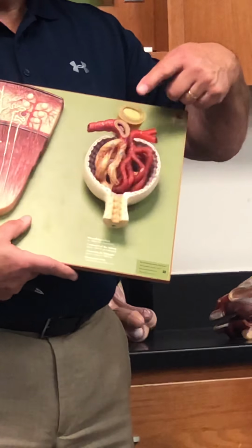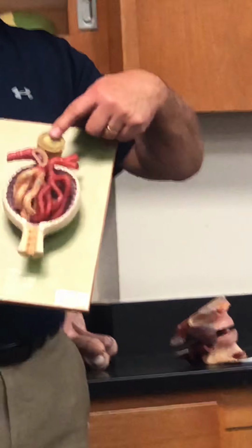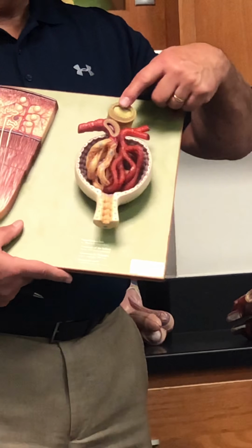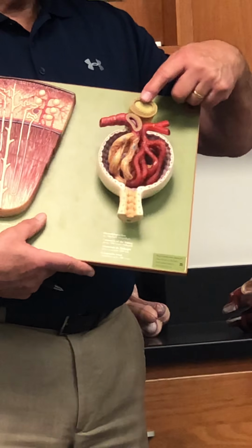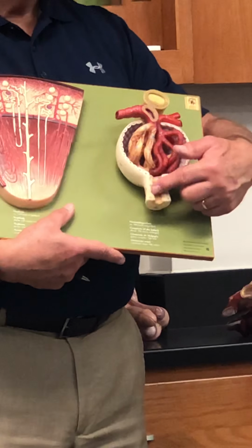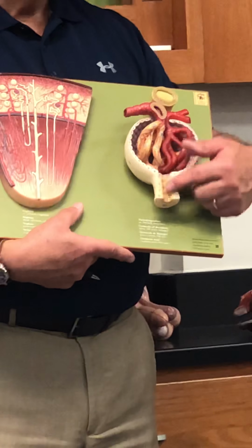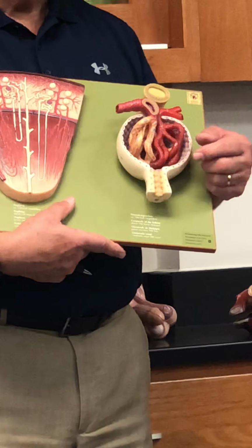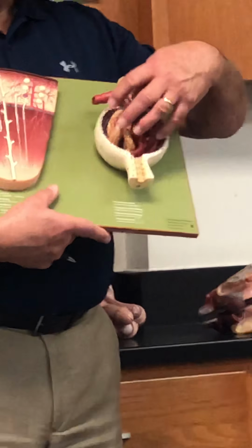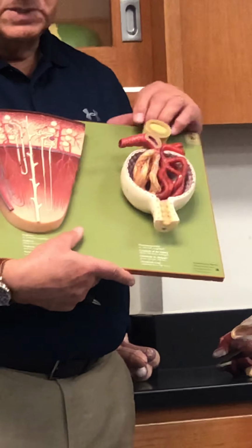How about this structure? This tube at the top. Distal, part of the distal convoluted tubule. Remember, it kind of comes back on itself. However, this is the beginning of the proximal convoluted tubule. Right, this is where all the filtration comes in. This is mostly plasma, right? And then it makes its way down the tubes, basically.